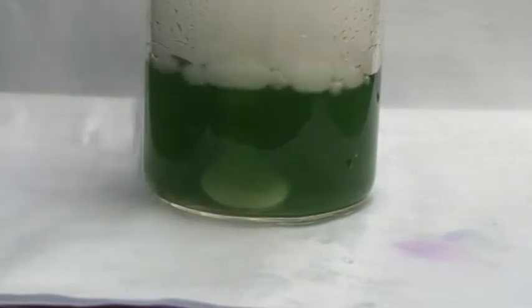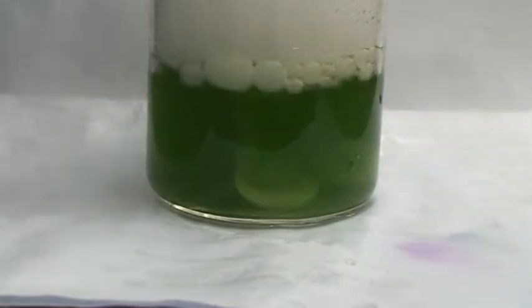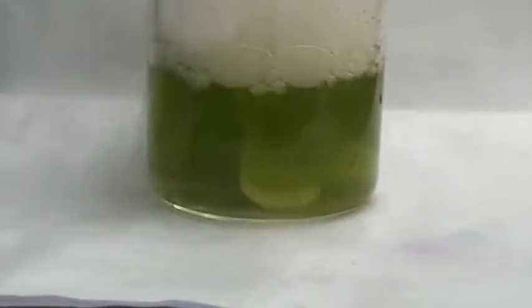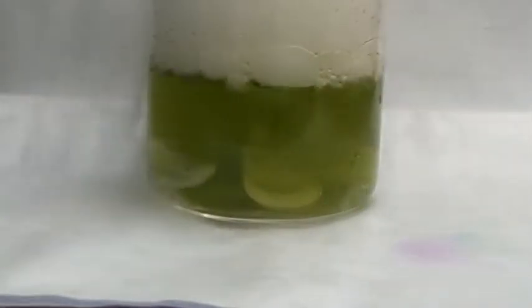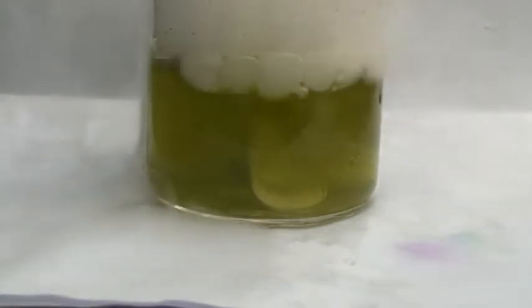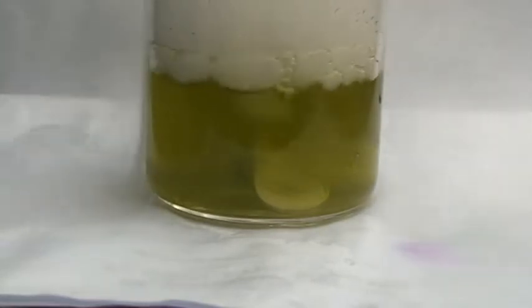Let's put in one more piece. This is like blowing exhaled air into the lime water like crazy. It's beginning to turn yellow. There will be a layer of ice surrounding the solid carbon dioxide because solid carbon dioxide has a sublimation point of minus 78 degrees Celsius.